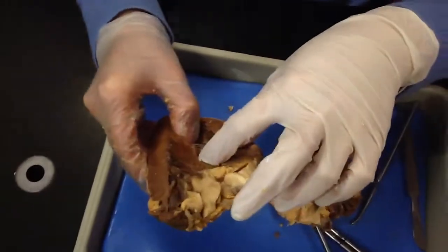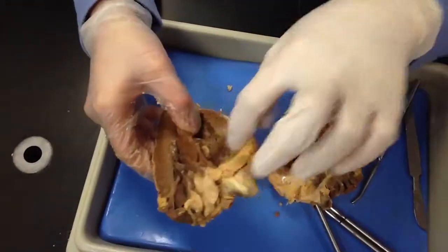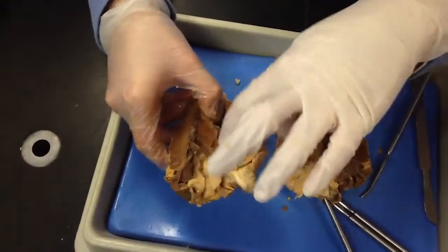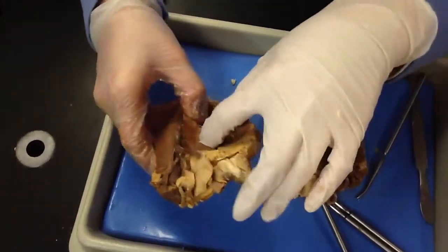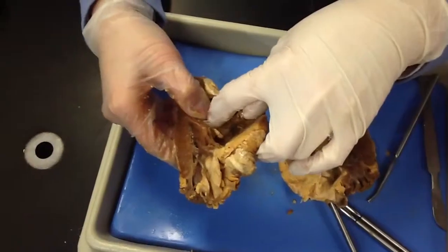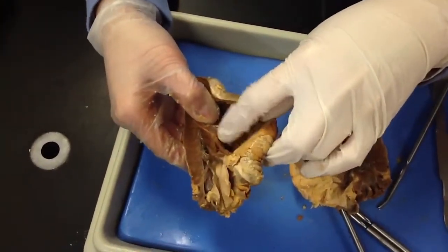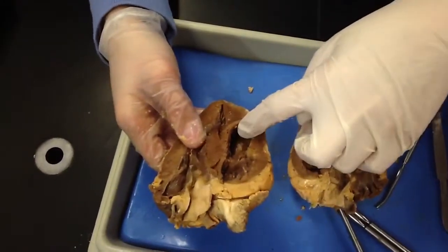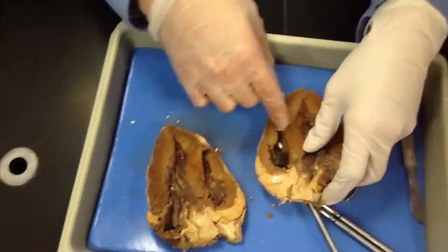All right. So you're going to go blood from the vena cava into the right atrium. Pass through the tricuspid valve, pulled shut by these chordae tendineae. You should be able to see them. They look like heartstrings, right? And then it's going to go into the right what? Ventricle.